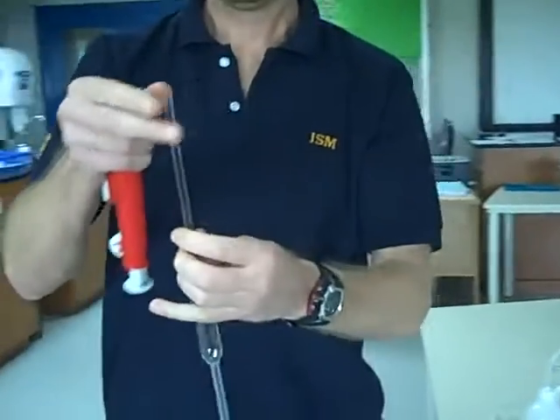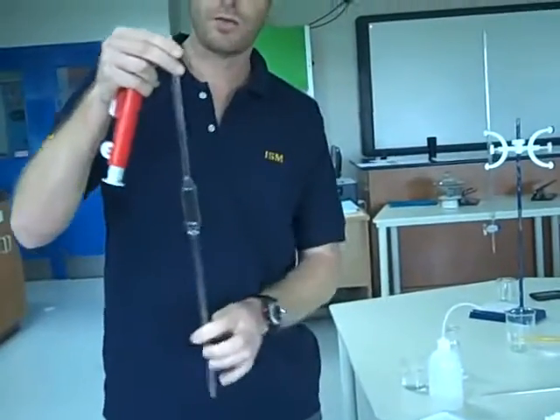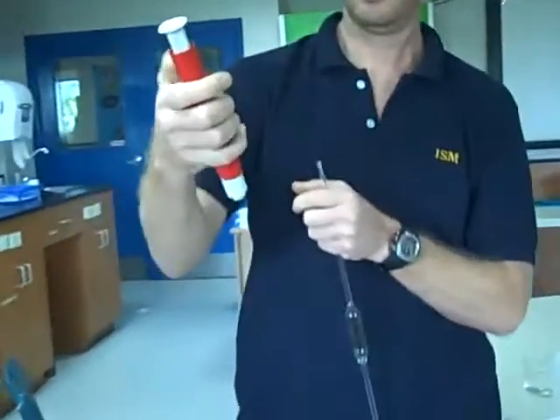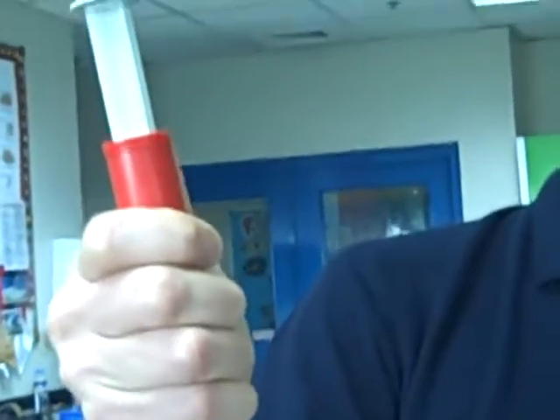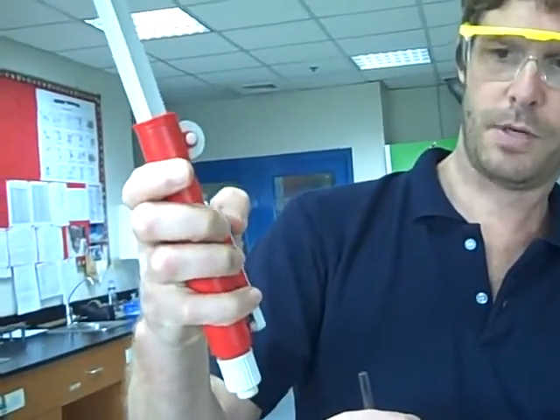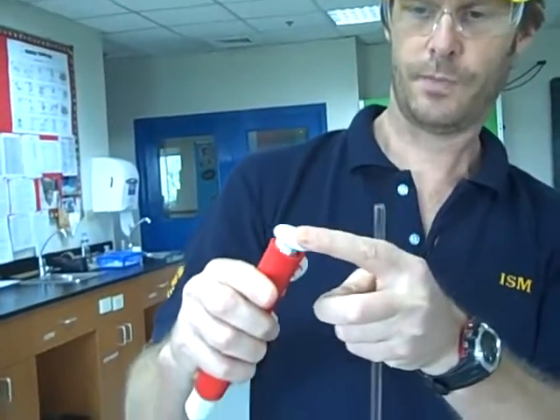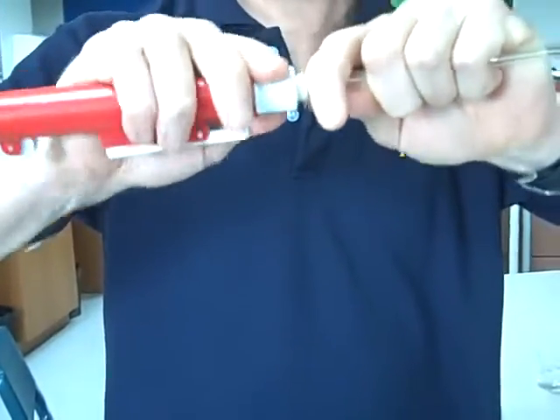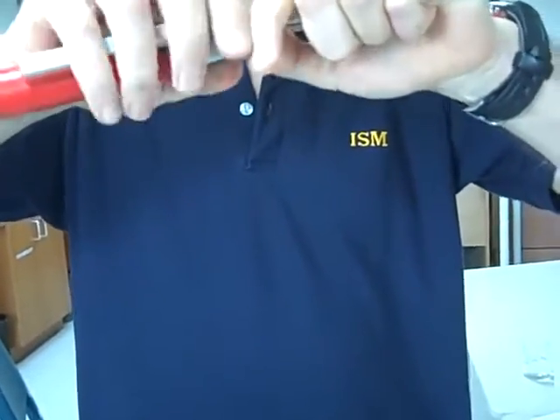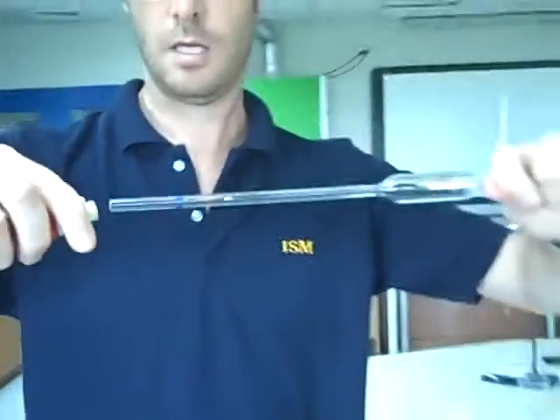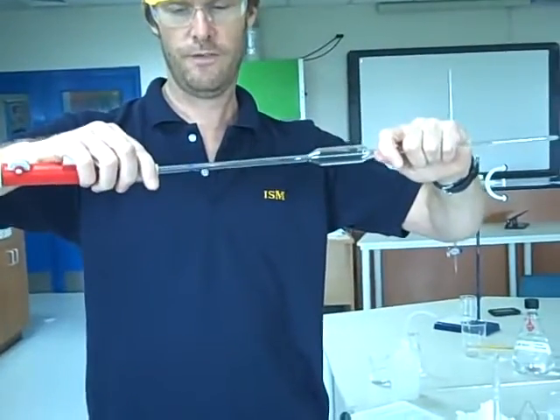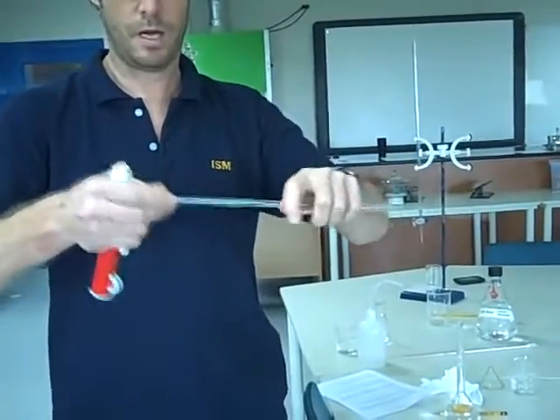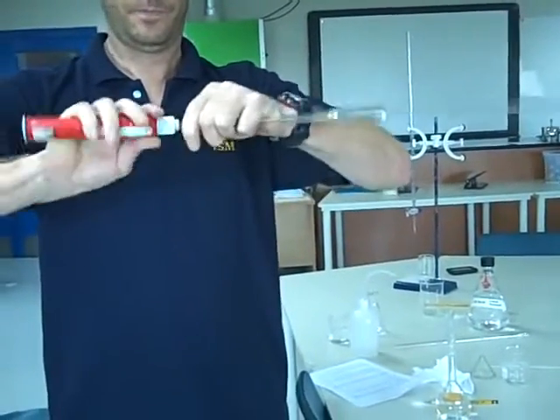I'm going to not suck the sodium hydroxide into it like I was able to do when I was at school, but you have to use a pipette filler. The pipette filler, we roll up like this with one finger, and then we can let out liquid by pressing this. However, I'll show you a slightly different way. These have to be placed on the pipette. We hold the glass tube close to the end and place it on here. I urge you please to hold it like that, not like this, as you'll find that if you force this, this can snap, the glass can go into your vein here, and you can spread blood across the lab, and I don't want to have to clean up after you, so care.